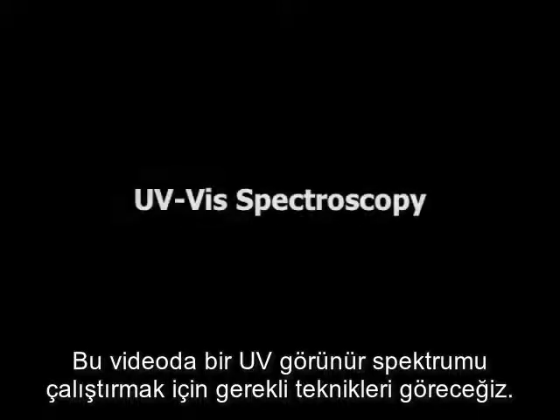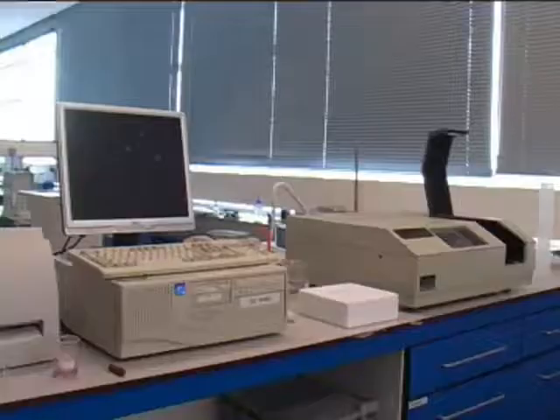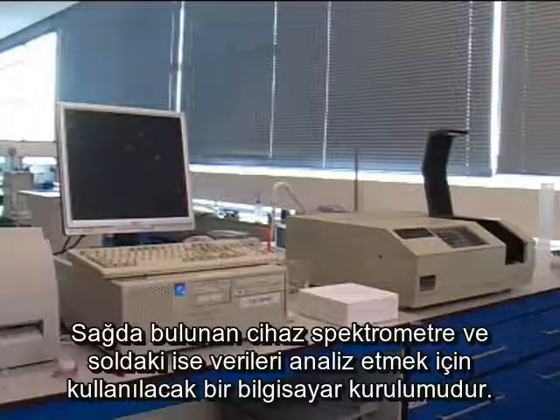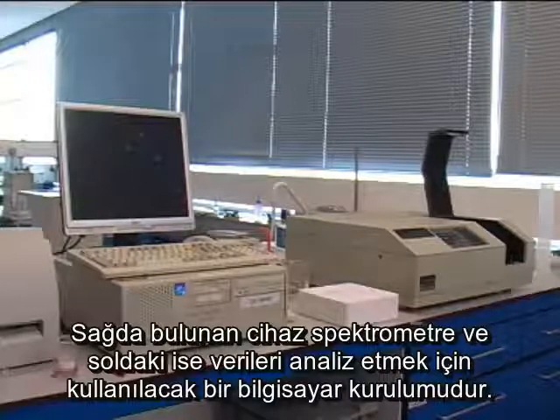In this video, you will see the techniques required to run a UV Vis spectrum. The theory side of UV Vis can be found in a presentation elsewhere. This is the setup required for UV Vis. On the right is a spectrometer, and on the left the computer which will be used to analyse the data.